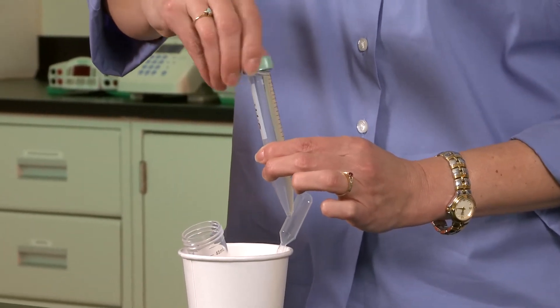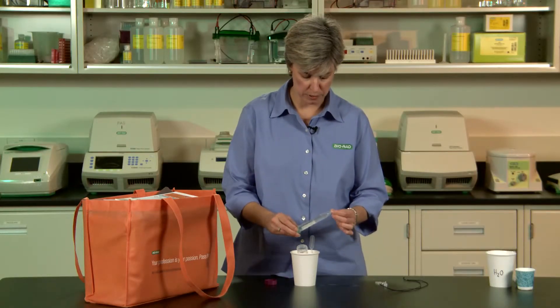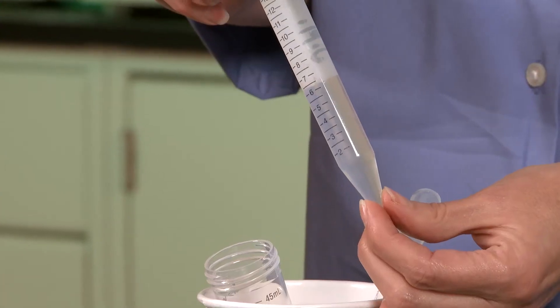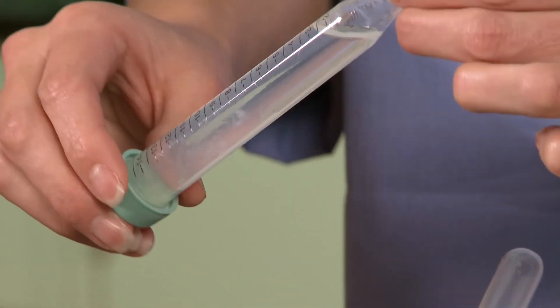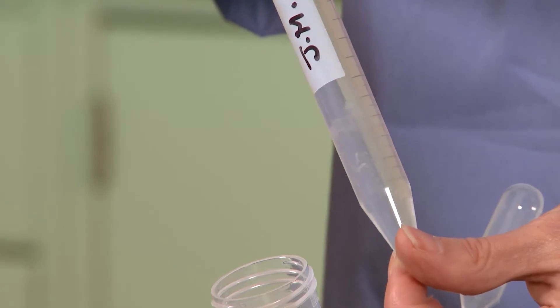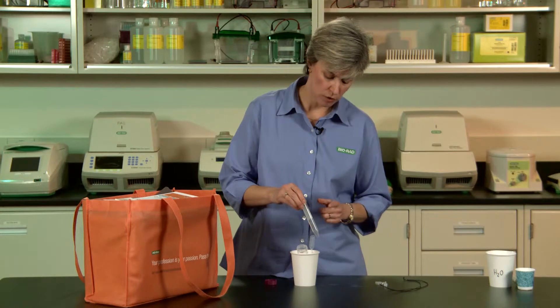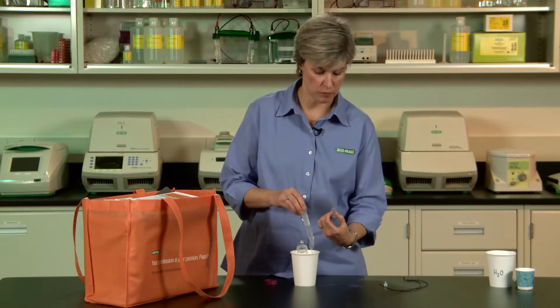So they've added that alcohol, and then you basically just want them to gently invert the tube a few times. I can already see my DNA precipitating in the tube — you start seeing some nice little stringy bits of DNA, and interestingly, they have some little bubbles clinging onto them. So hopefully you can see there are some strands of DNA that have now come into view. The tricky step that's next — not too tricky — is transferring the DNA from the big tube into their DNA necklace vial.